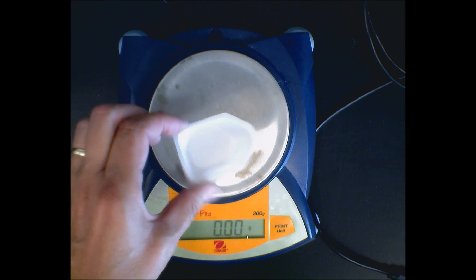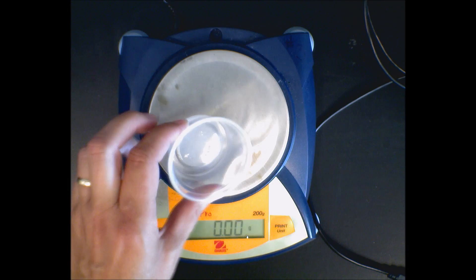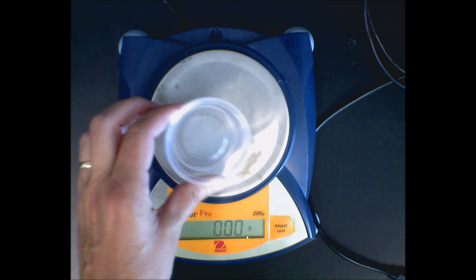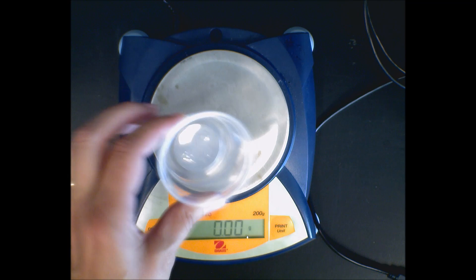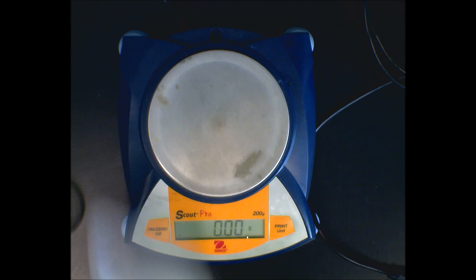You can even use any sort of plastic or glass container. A beaker can be used as a weighing boat, but you never put the chemical directly on there.